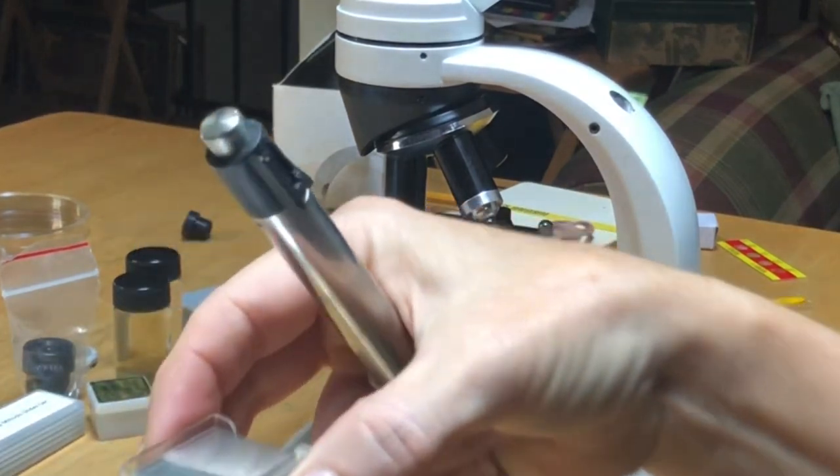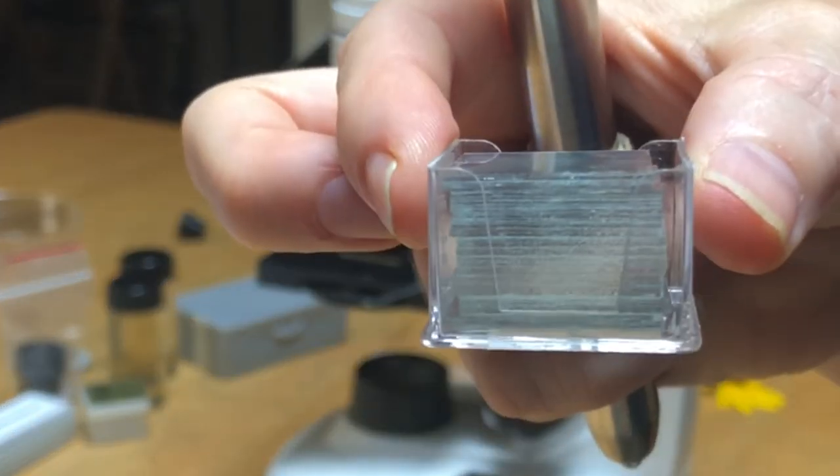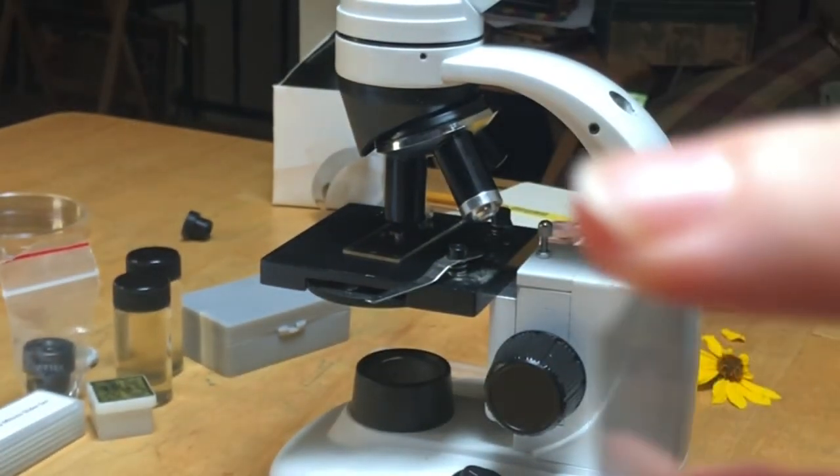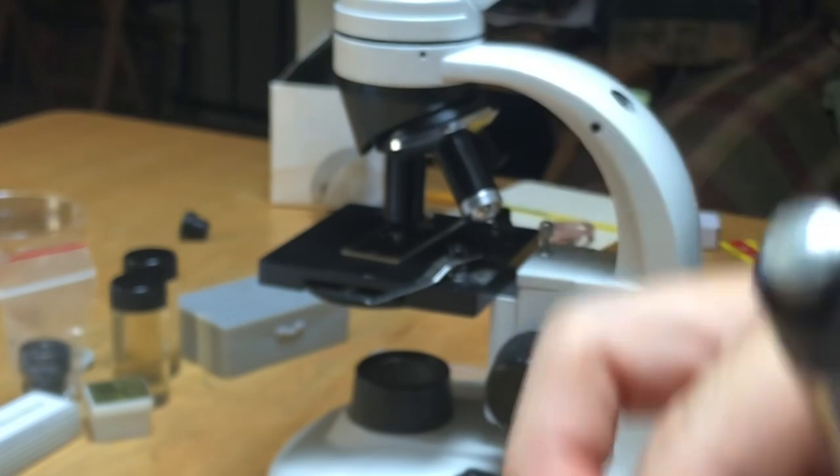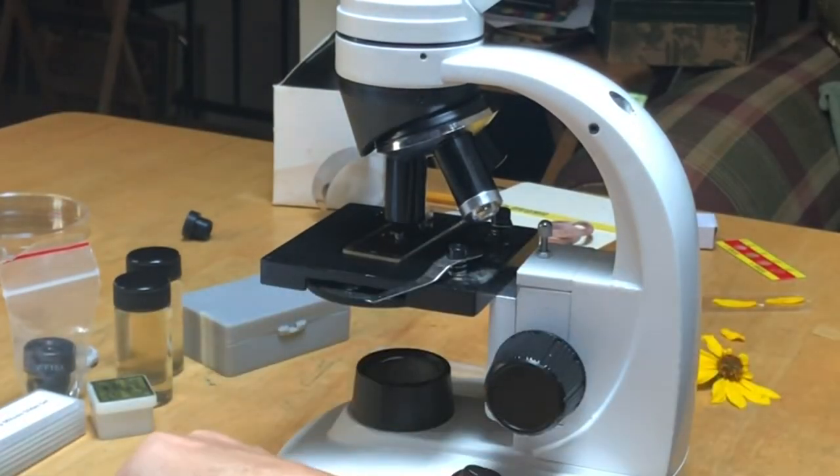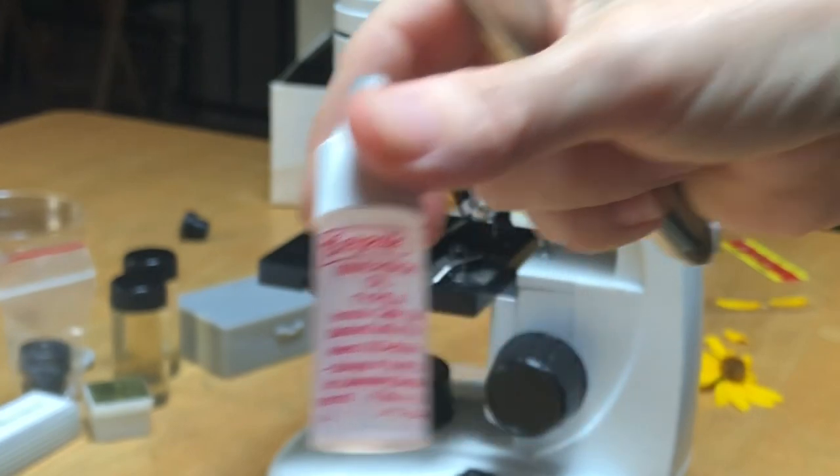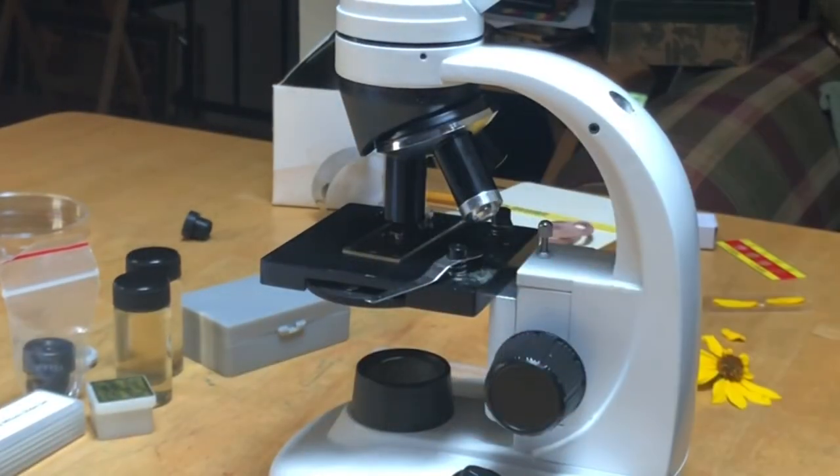And in order to use those you need a glass slip cover, so that is what these are, I don't know if you can see those, and you need immersion oil which is what this is. And I'm not going to use that today.